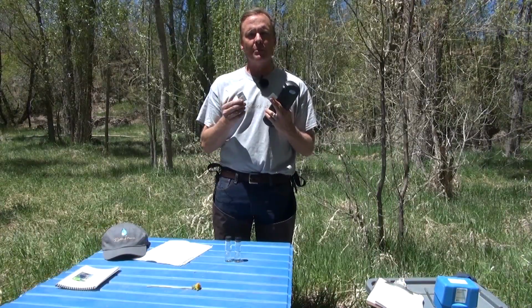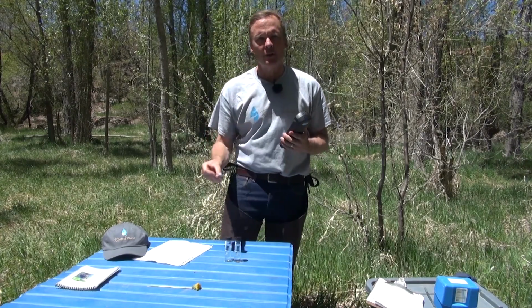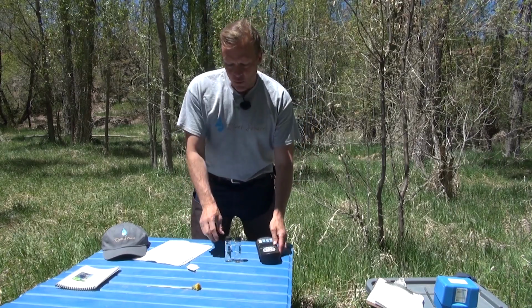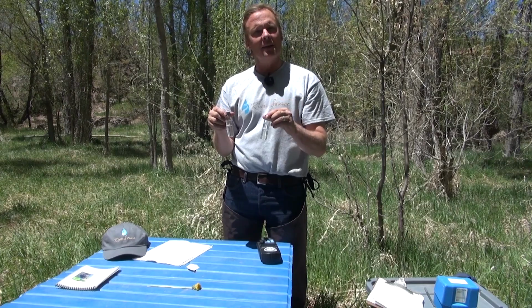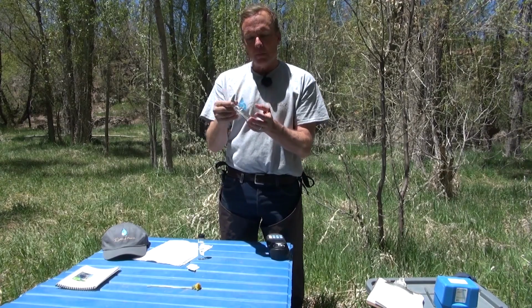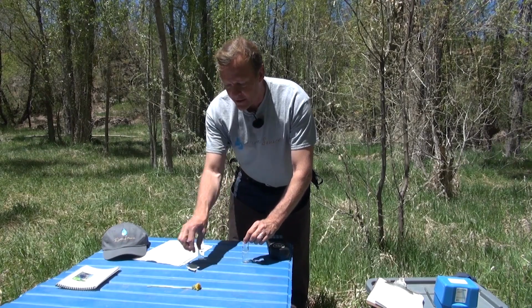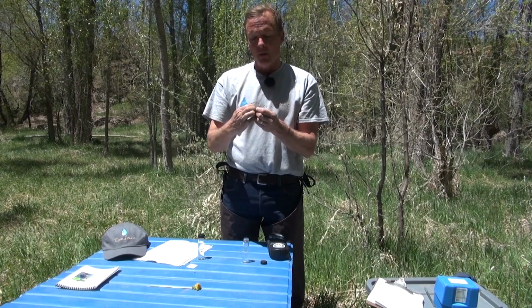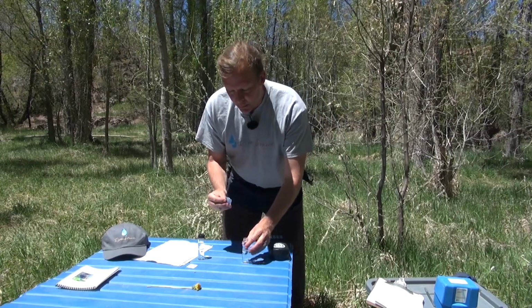And we have 2 types of powder pillows. The smaller one is for nitrates, one is for phosphorus. We're going to go ahead and start the phosphorus colorimeter test right now. So what I'm going to do is identify which of these sample cells is going to be my blank. I'm not going to add anything to it. I'm going to set that to the side over here, and then I'm going to go ahead and open the cap for this one and add all the contents from this reactive phosphorus powder pillow. And if there is phosphorus in the water, the color signature for this particular element is blue.